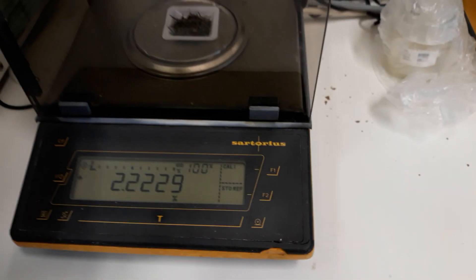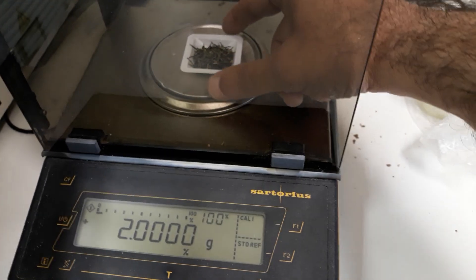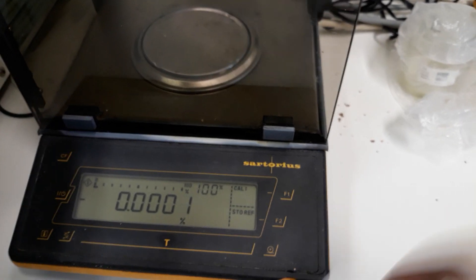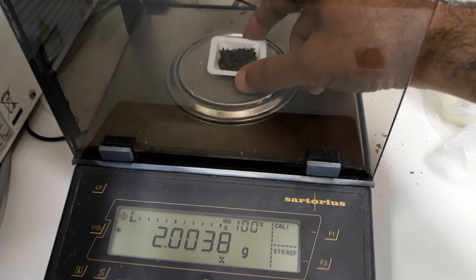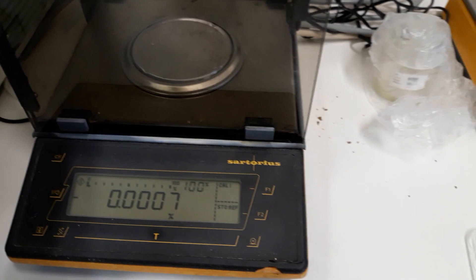I have measured two grams of each of these samples, so you can see the weights are quite consistent. It's very important to have a nice quantification about this measurement when it comes to the comparison.